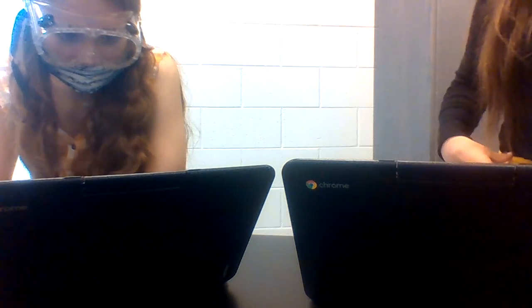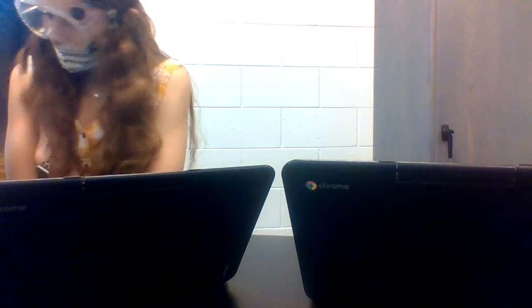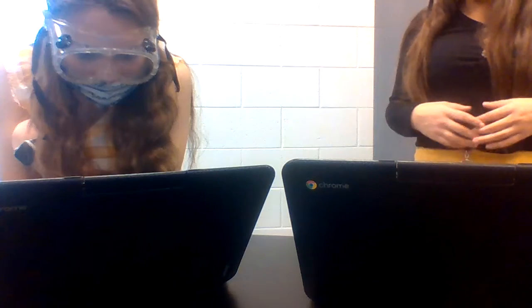Right? No, I think that we just pour it back in there and then we redo it. On the density problem, we do not need to do that calculation at this time. Let's save that for later. You can do that at home. We just need to get the data today. So fill in the volume and the mass measurements right now.